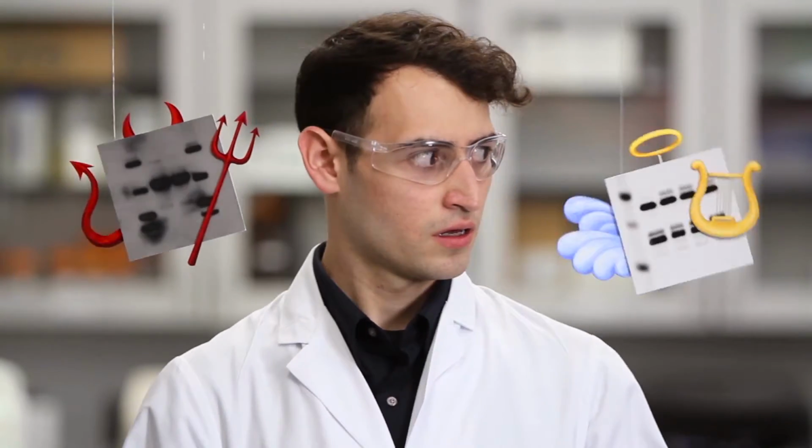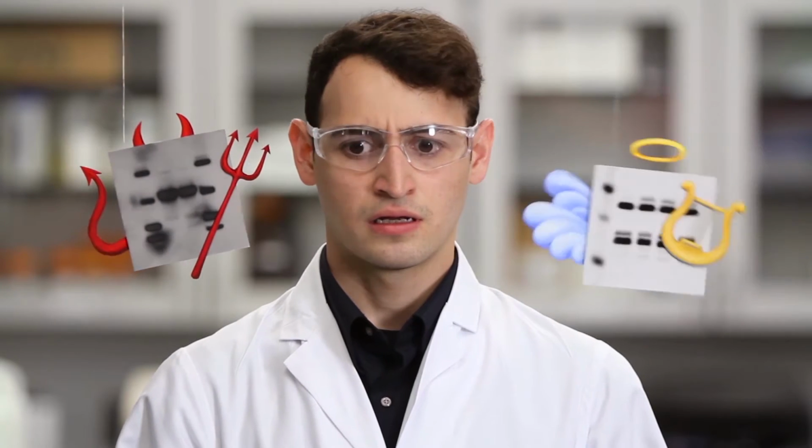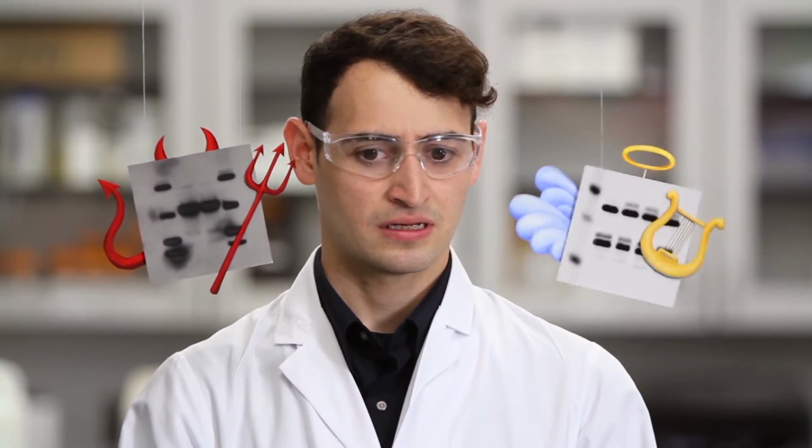What are you waiting for? Do it already. Aren't you forgetting something? What about a loading control? Oh, shut up, Mr. Golden Blot. Hey, watch your tone. A loading control is definitely necessary if you want to be sure changes on your blot are real. Oh, we already have to do this 20 times.